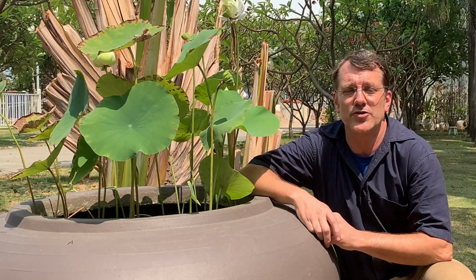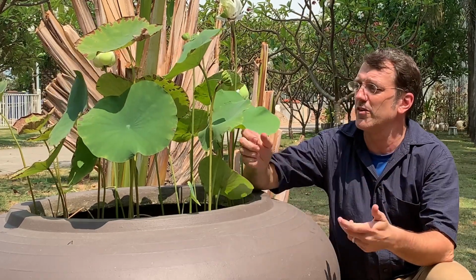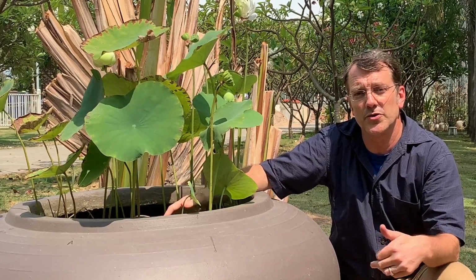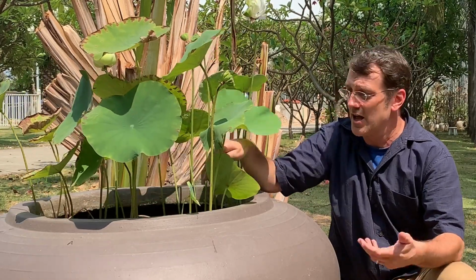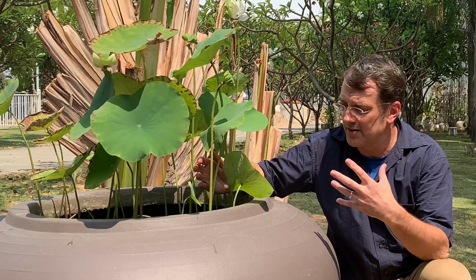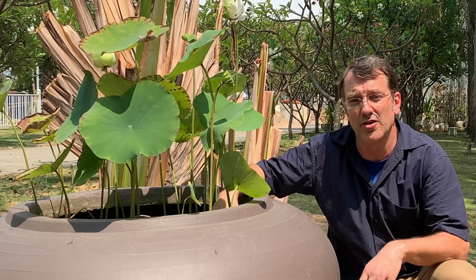So the first site we've chosen to investigate our water quality is this pot with a bunch of aquatic lotus plants growing in it. And here, inside this water, we expect to find a bunch of microbes. We might also find some frog tadpoles. I can see algae growing in here. And of course, we have the aquatic plants themselves. So this will give us an opportunity to see how the different organisms in the aquatic environment interact and affect the dissolved oxygen level.